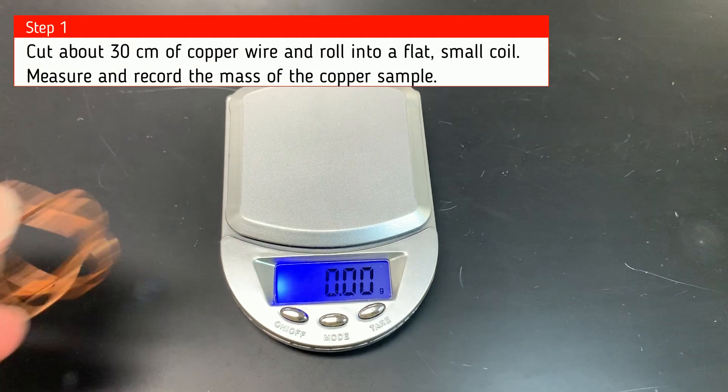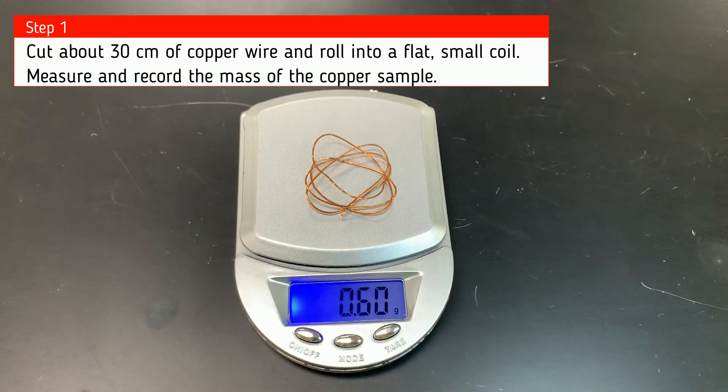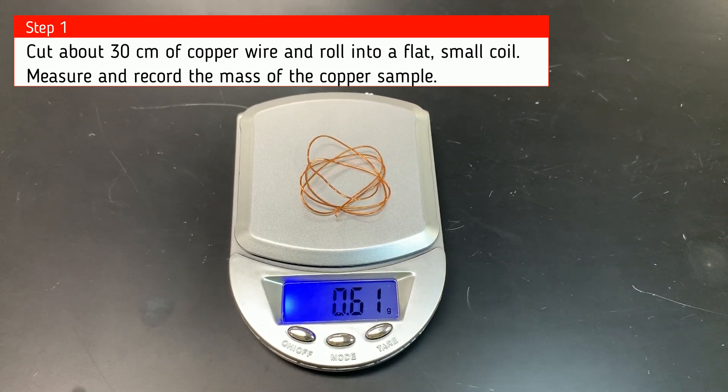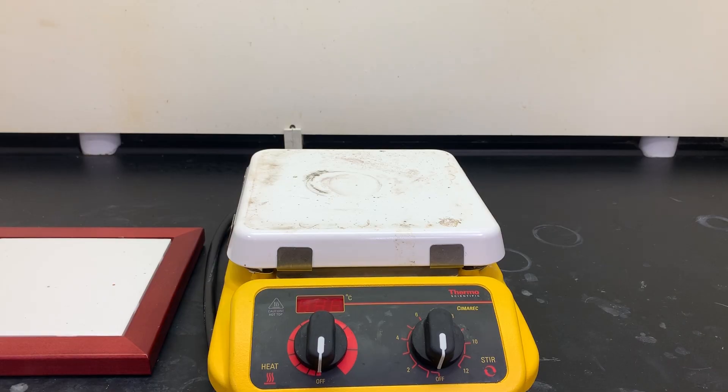First we will cut about 30 centimeters of copper wire, roll it into a flat small coil, and measure and record the mass of this copper sample.